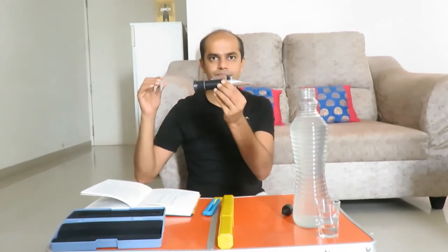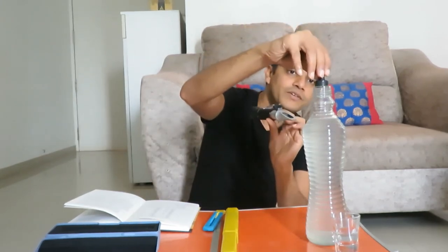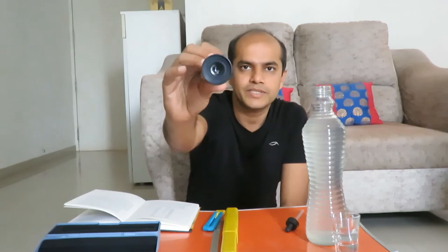The other indirect method is the refractometer. It measures the refractive index of the solution. Taking just two drops of liquid and closing the refractometer, it is showing 19 Brix. In a refractometer you see a horizon where the top is blue and the bottom is white. We measure the dividing line between blue and white against a vertical scale to find the change in refractive index. Water reads at zero Brix, and this solution reads at 19 Brix.